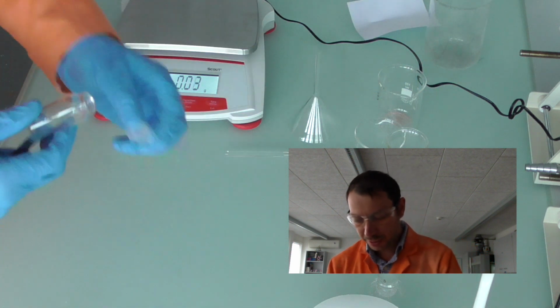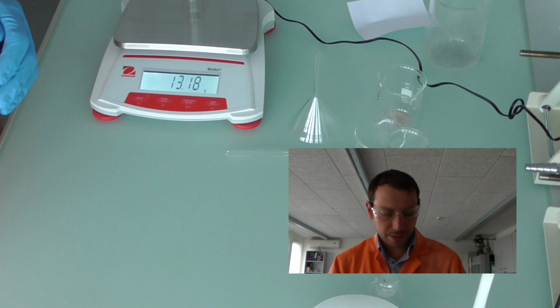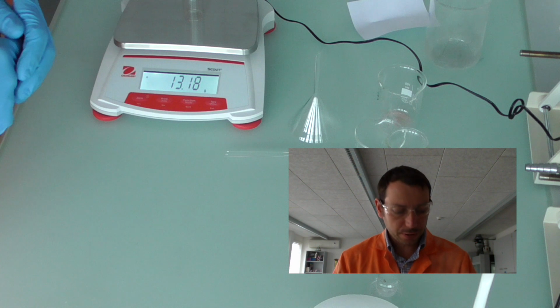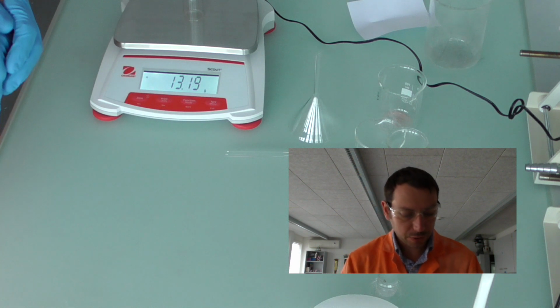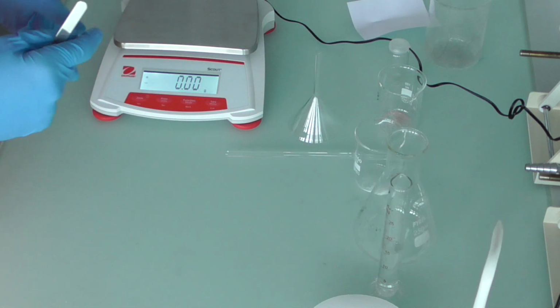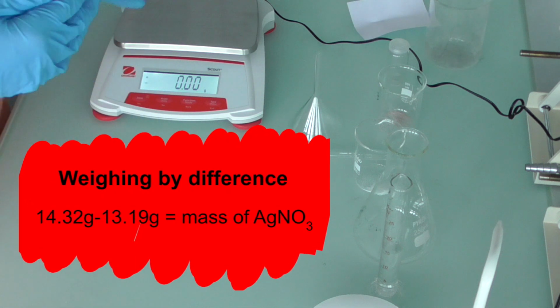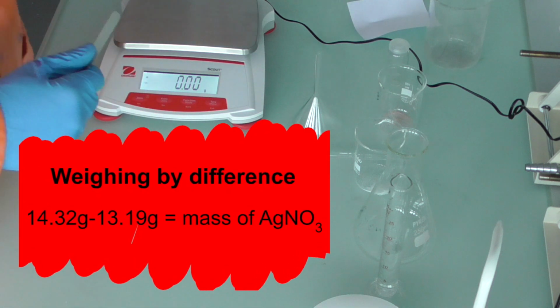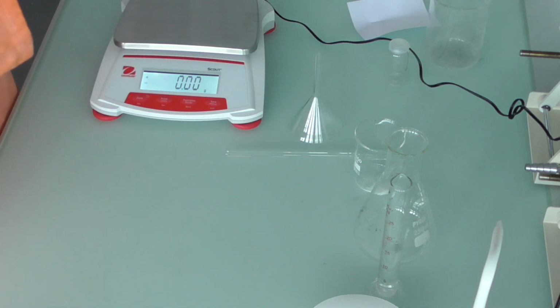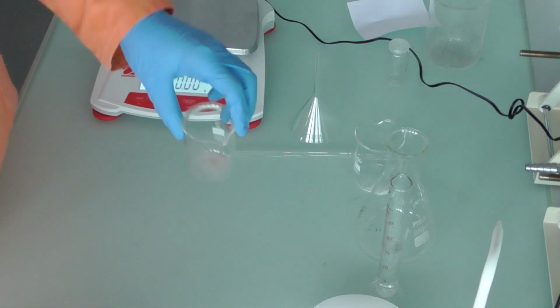What I'm going to do is take my vial and cap and put it back on the balance. I'm going to record that value as 13.19 grams. That's what we call weighing by difference, because if I take my original 14.32 and then subtract my 13.19, I'll get the mass of the silver nitrate in the beaker.